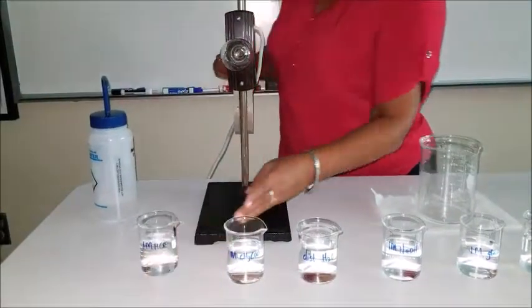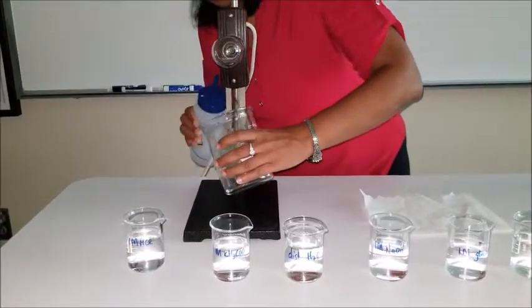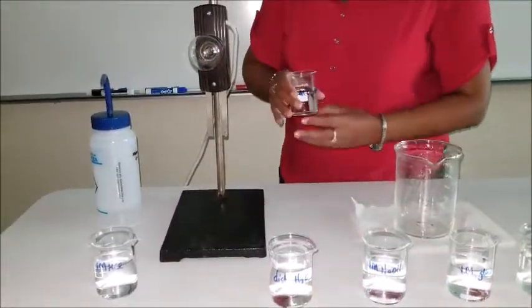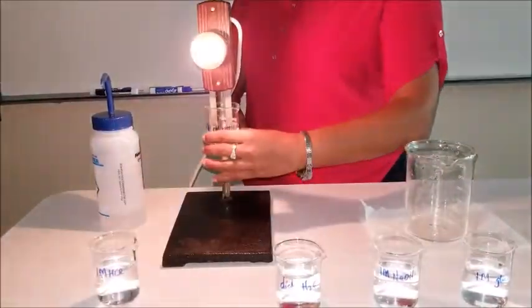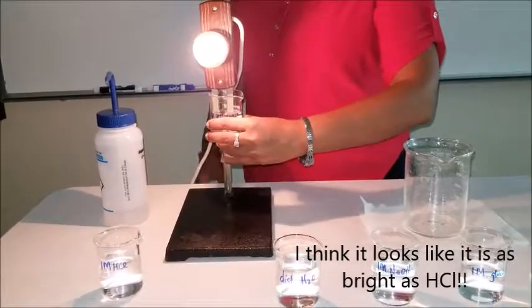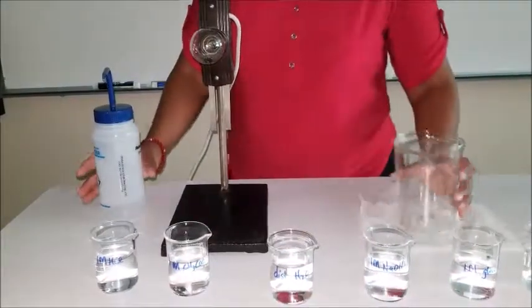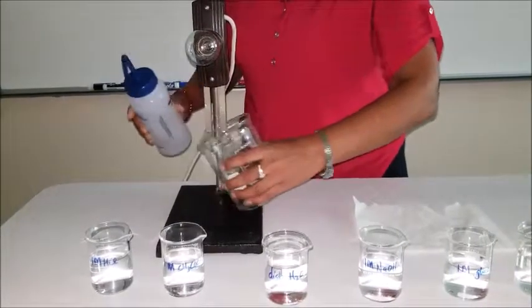The first one was HCl, or hydrochloric acid. I'm going to wash this now. No contamination, we're good chemists. And then I will take acetic acid, which is considered to be a weak acid. Rate this with HCl. Again, go from 1 through 10 and see how you feel. I will repeat this again later, so in case you missed anything, you can just rewind the video and see it again. I will do it again quickly at the end.